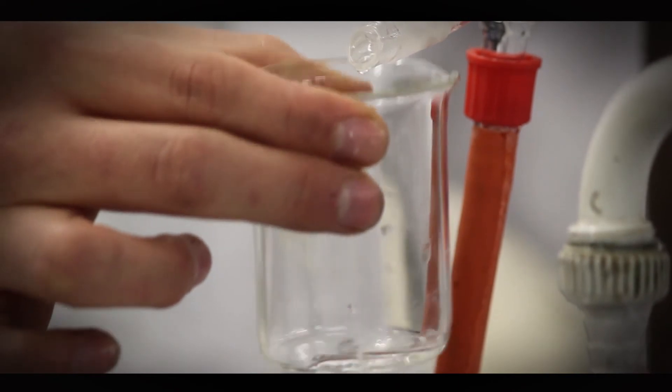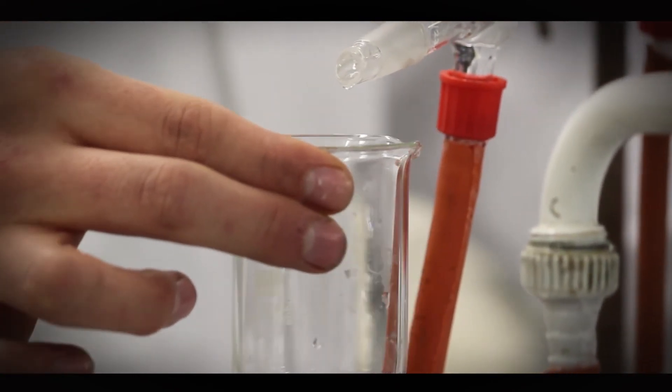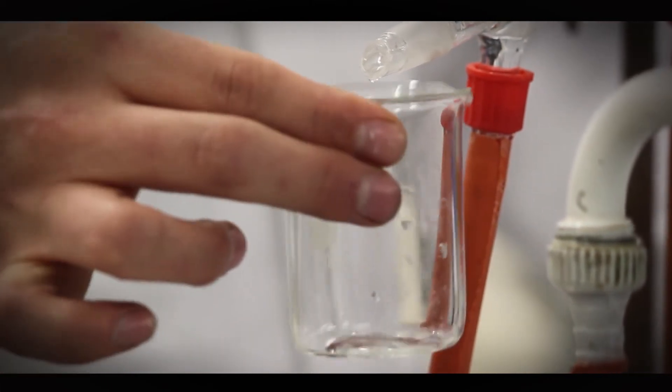There we are, it's coming out. You're seeing it's clear. That's a difference. That's because I've separated the mixture. I've made it pure. This is now distilled water.